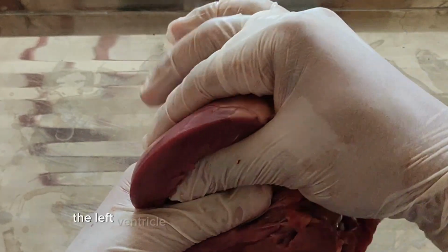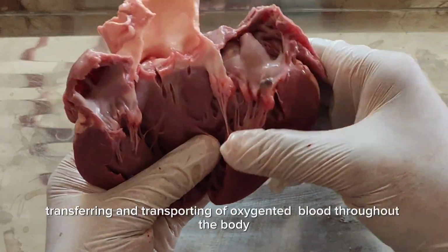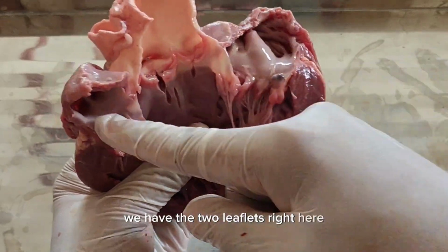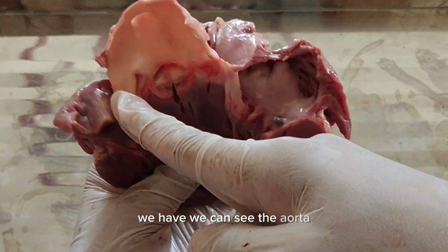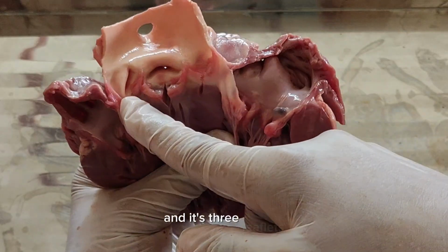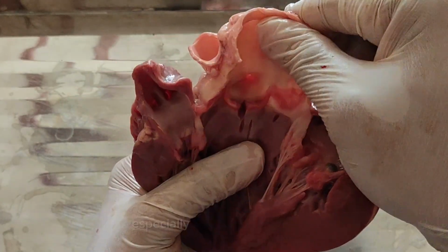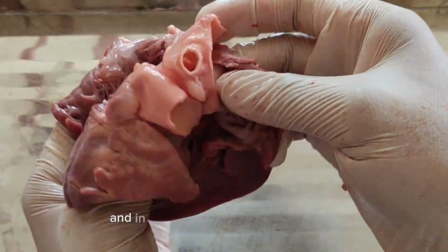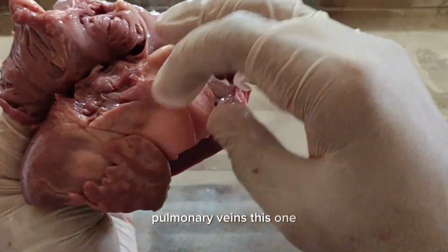Again, the left ventricle is thick because it's responsible for transporting oxygenated blood throughout the body. This is our bicuspid valve. We have the two leaflets right here. And towards the bicuspid valve, we can see the aorta, the major artery in our body. It has 3 leaflets. 1, 2, 3. And through here, we have the coronary sinus. It's actually a hole right there. See? And in here on the left, we also have the pulmonary veins. This one.